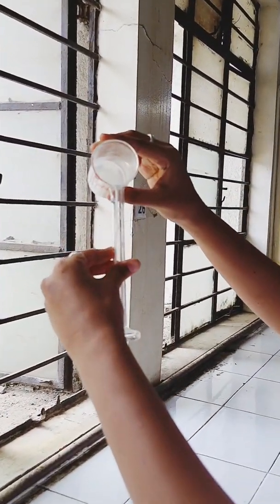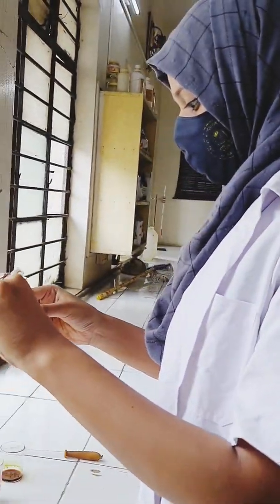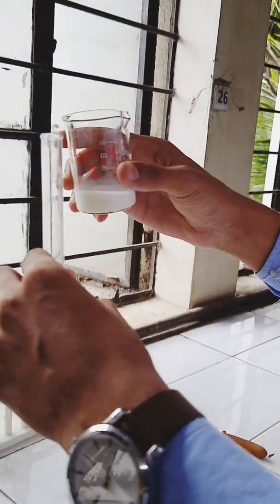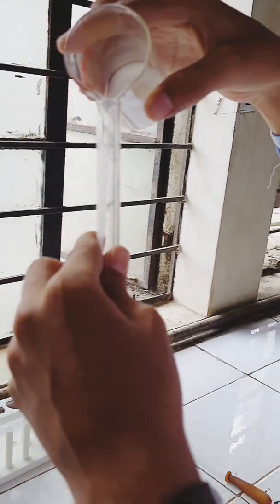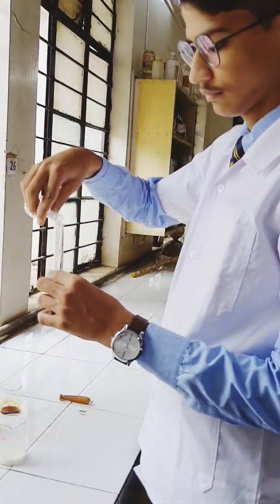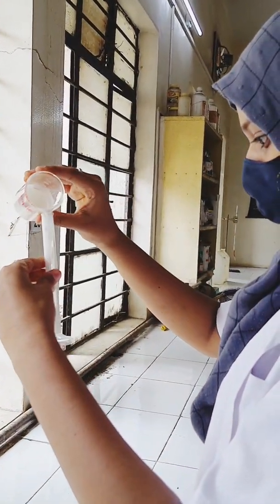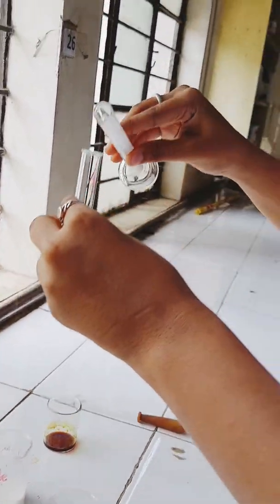Measure 3 ml of the first sample in a test tube. Similarly, measure 3 ml of the second and third samples in separate test tubes. Here, this is the second sample of milk — measure 3 ml and pour it into the test tube. Next, the third sample of milk — again, measure 3 ml and pour it into the third test tube.